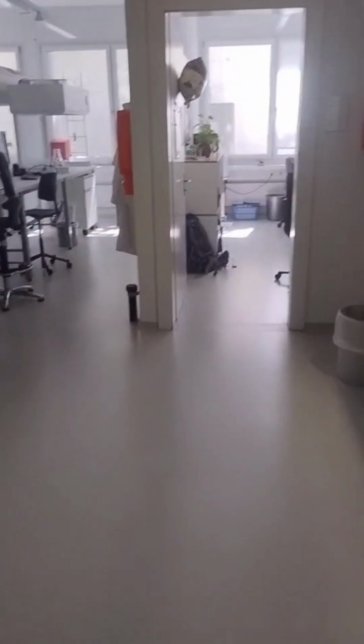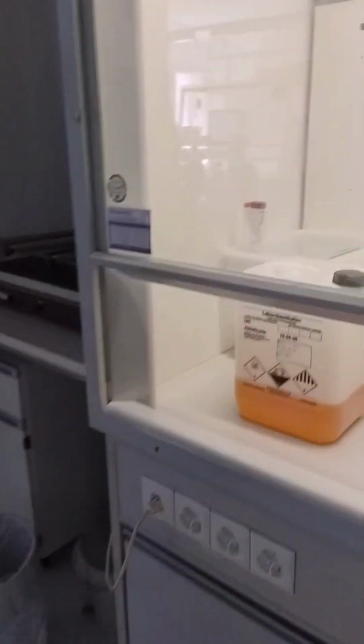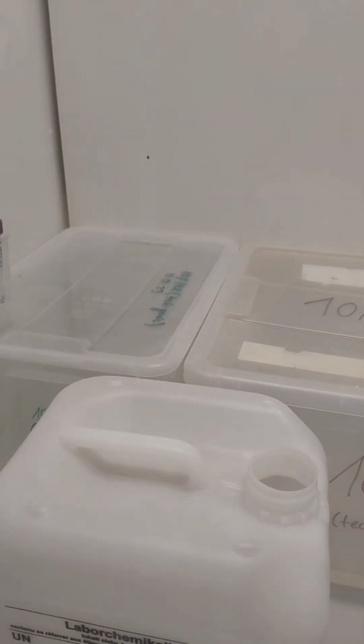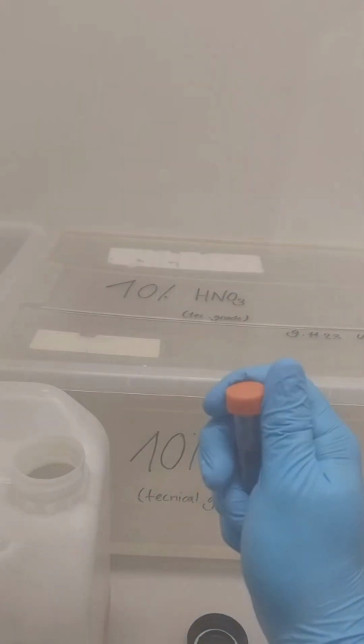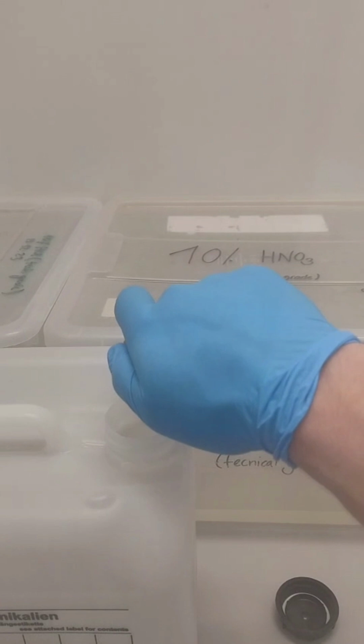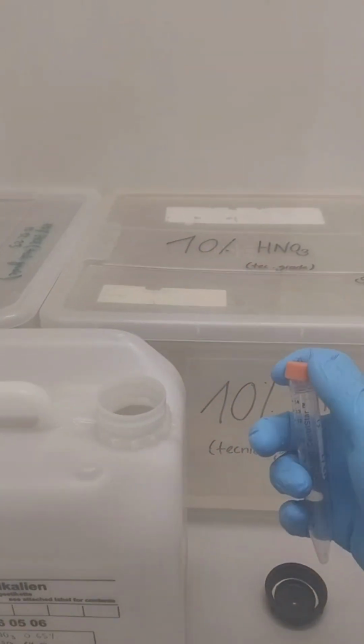Tubes have to be disposed of correctly as well. We'll show you how. If they contain any liquid, pour it out following the correct liquid waste disposal procedure. If you're unsure how to do this, refer to cLab tutorial 2.2 on liquid waste disposal.